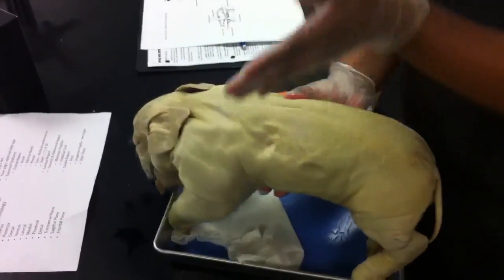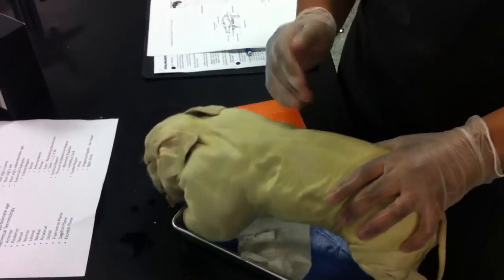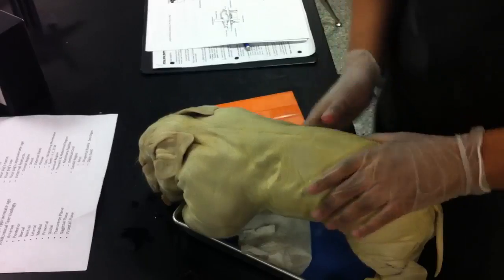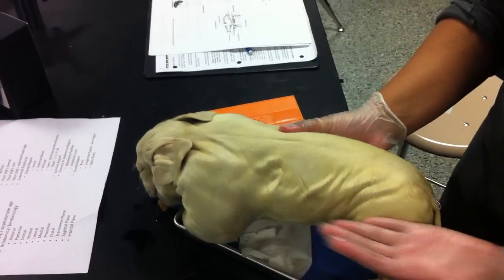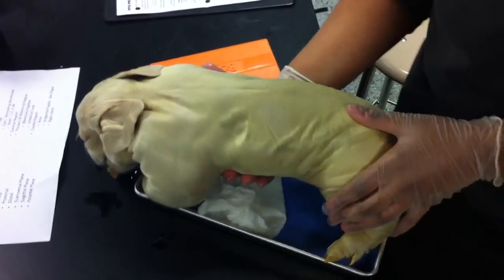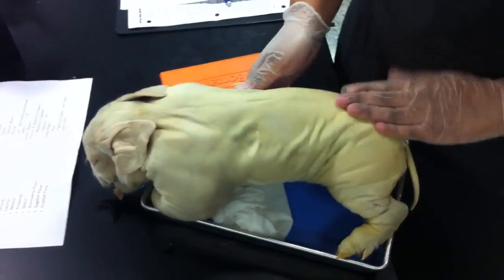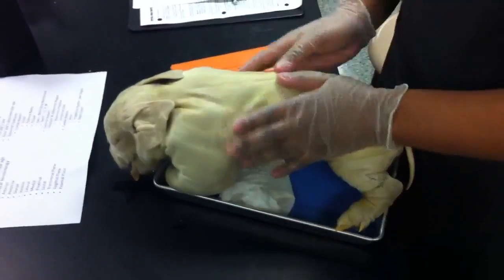This is the transverse plane — it cuts the pig into front and back parts. This is the frontal plane — it cuts the pig into top and bottom side parts. This is the sagittal plane — it cuts it into side parts.